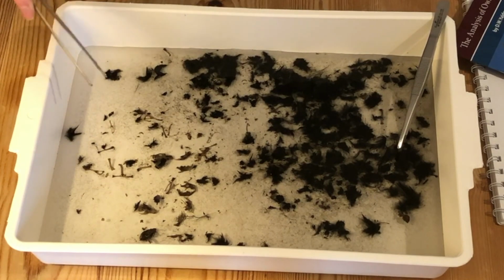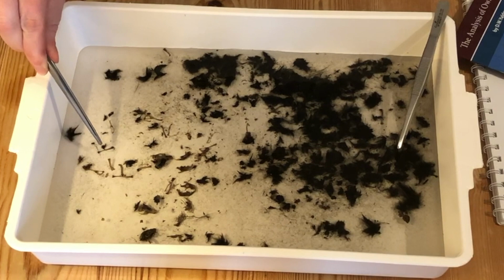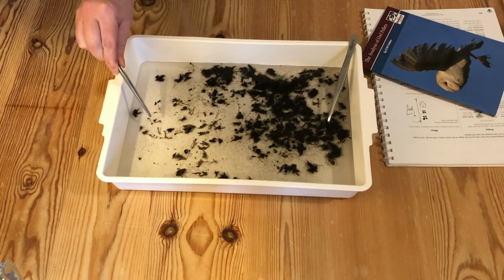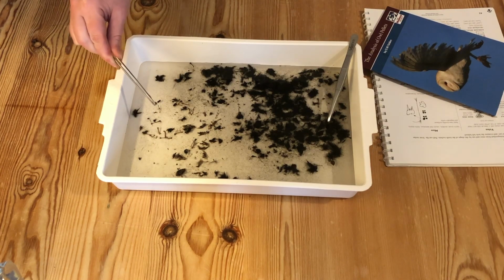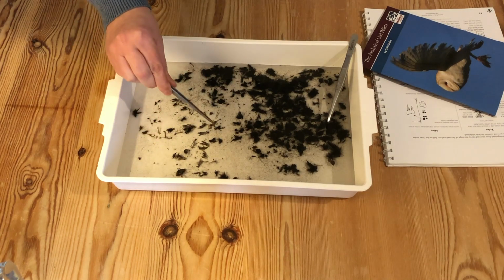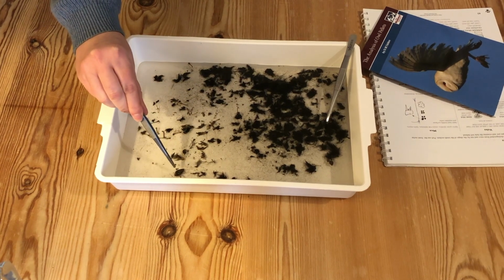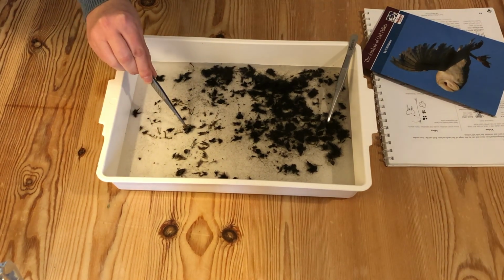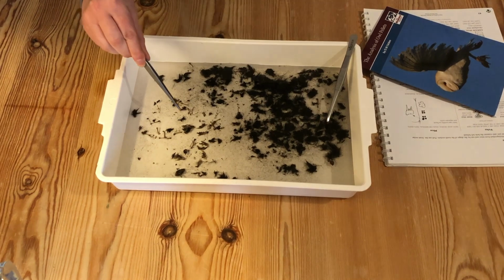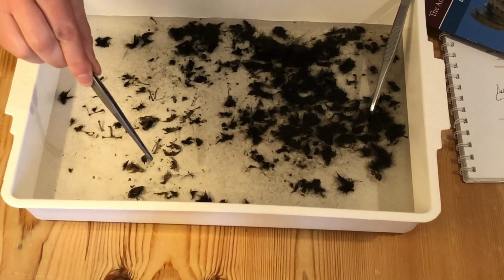It's quite difficult to use these smaller bones in identification to species. So, and also because we're doing a mammals course, we're going to focus on the mammal remains that we've got in here. So what we're actually going to focus on are these bones here. So we've actually managed to separate 1, 2, 3, 4 skull sections of small mammals, and 1, 2, 3, 4, 5, 6, 7 lower jaw sections.